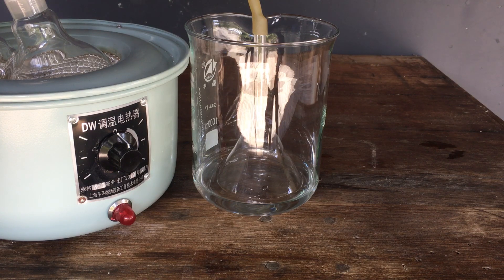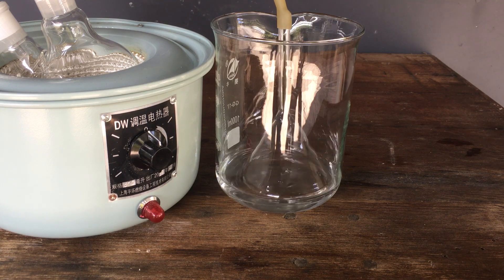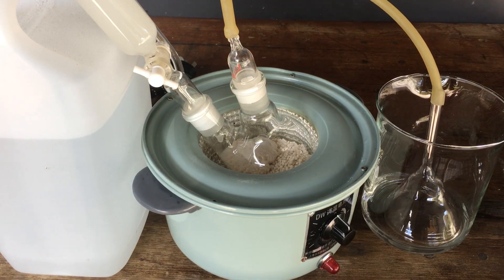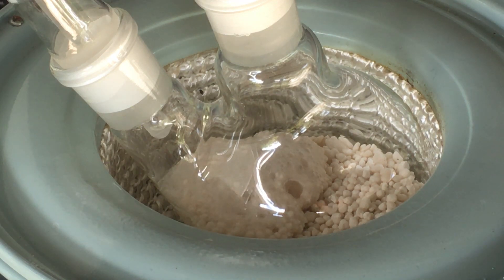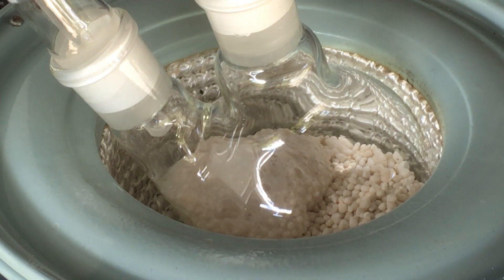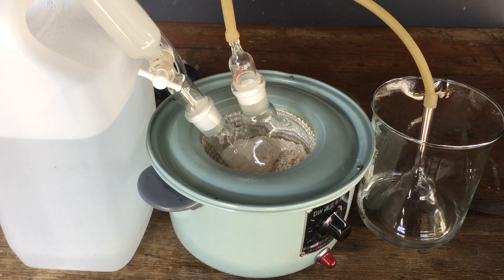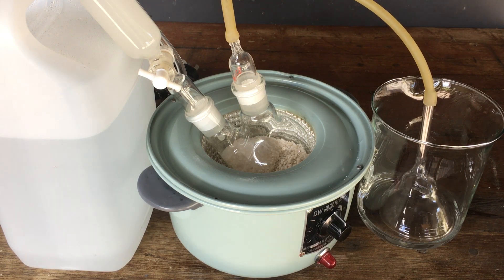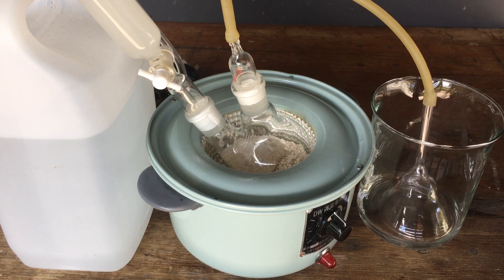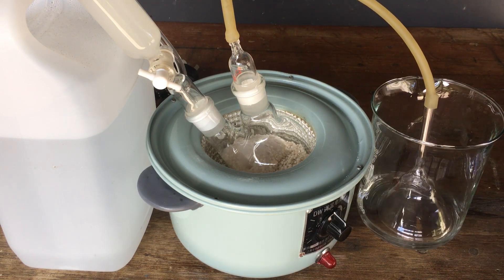Hopefully I don't generate too much too quickly. Nice — that's exactly what we want to see. And to give you a shot of what's going on in the flask, you can see a whole bunch of ammonia gas coming off the reaction. I might slow it down, but it seems to be relatively well behaved for now. You can see over here we've got the ammonia gas — obviously it's just regular air at this stage because the whole system hasn't filled up with ammonia, but pretty soon that will be pure ammonia gas coming through and dissolving into solution.